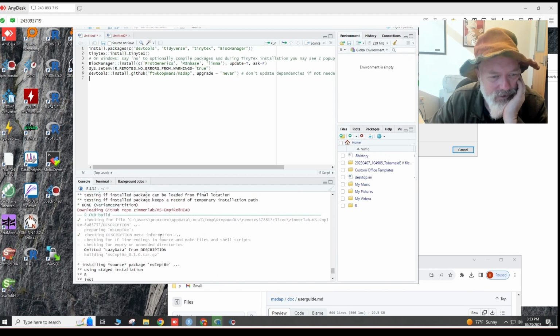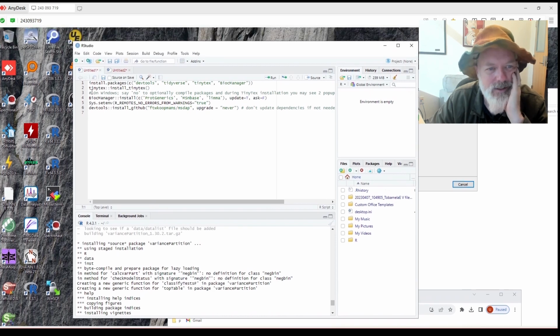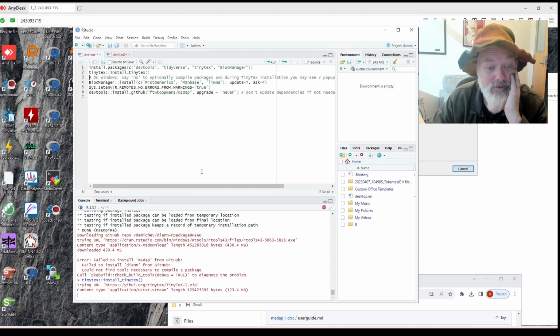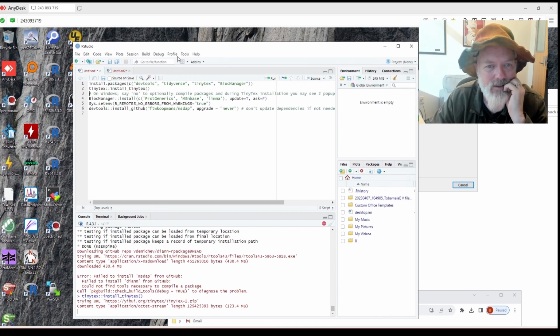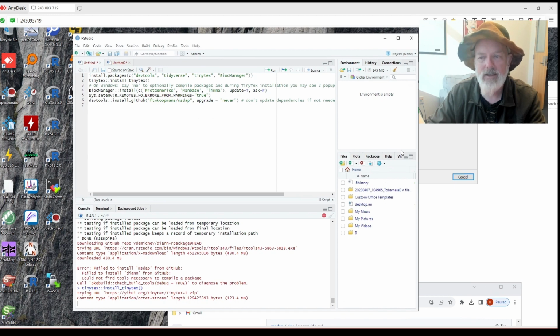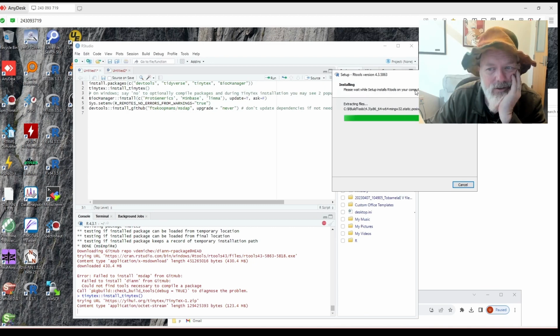Okay, so where did it fail last time? I think TinyTeX has been installed. Let's see. We can do that now while RTools is being installed, I think. We'll see. I've had trouble with this TinyTeX too, and I've had to install it using the tools install packages, I think. All right, let's give that a shot. Okay, almost done. I may have just screwed this up by trying to do it out of order. Okay, you're taking a long time.